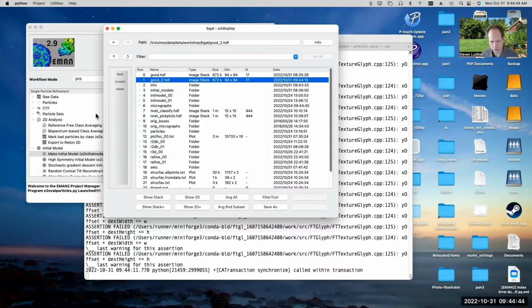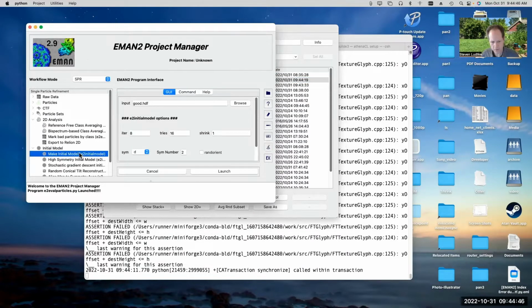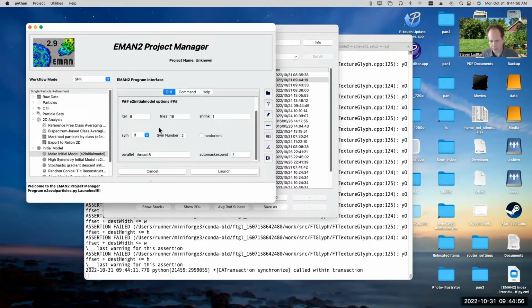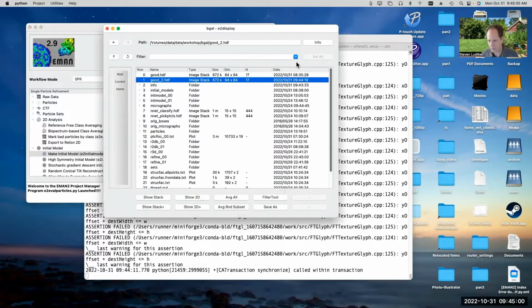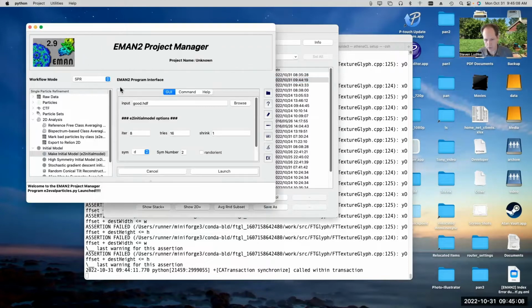Once you've got your good particles, then you can go over to this Make Initial Model box, and you can select the file name that you just produced, the file containing just the handful of good particles, and then fill in these few options here. Now, since I'm using particles here that were already downsampled, right? These particles are already 84 by 84 pixels, not the 256 by 256 that the original particles were. I don't need to use this shrink option here.